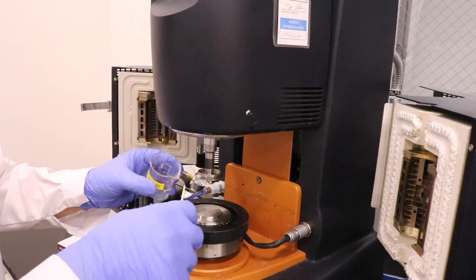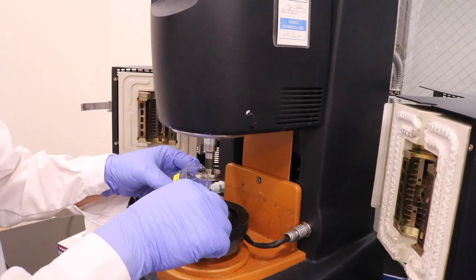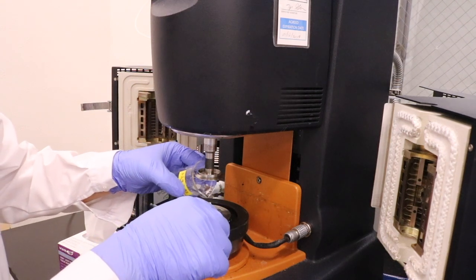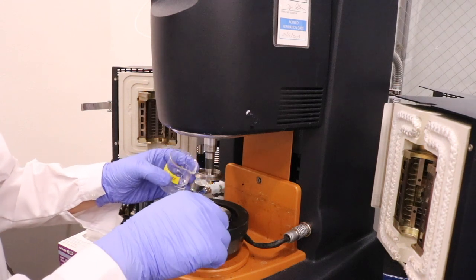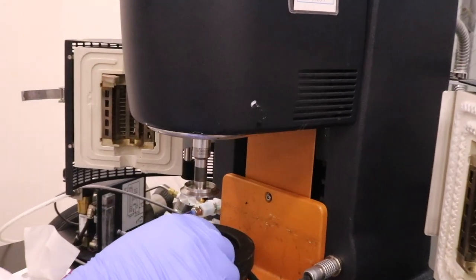First, we will load the samples between the parallel plates. And during this step, make sure there's no bubbles trapped in between the plates.